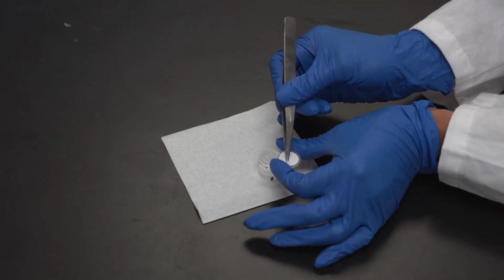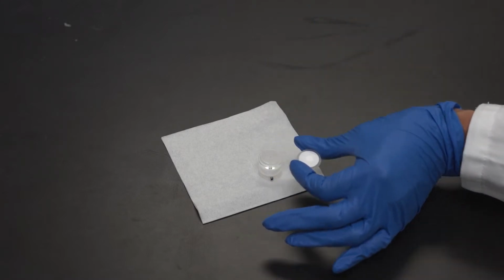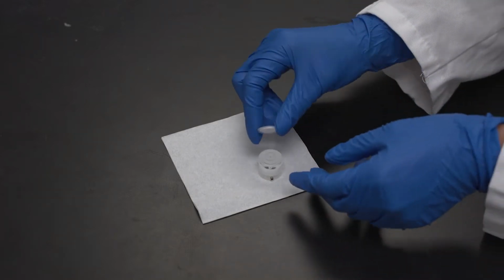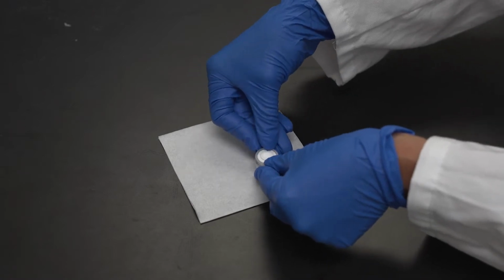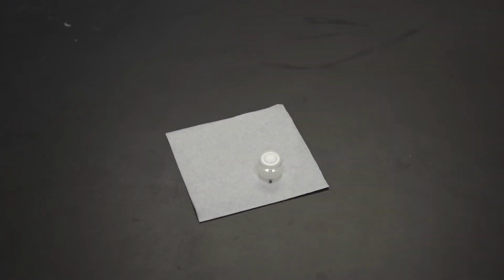membrane. And then center the PVDF membrane so that it will remain fixed in the raised ring on the upper reactor chamber. Press down on the filter holder to attach the PTFE, PVDF, PTFE sandwich to the upper reactor chamber. Flip the reactor chamber and spacer and reassemble the reactor by performing the reverse steps from the disassembly.